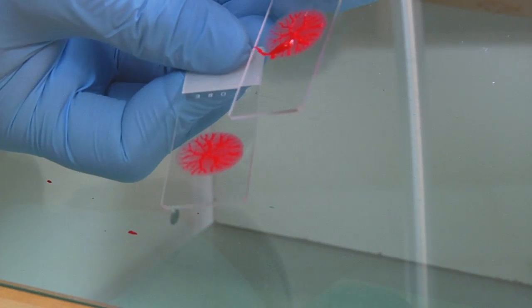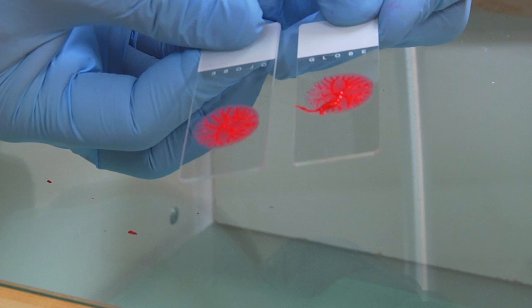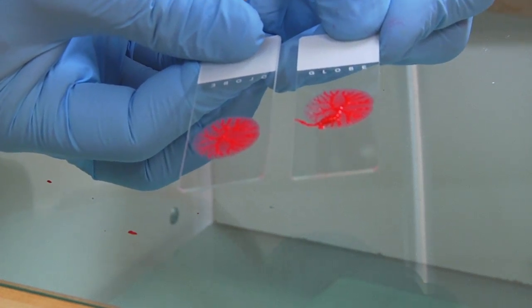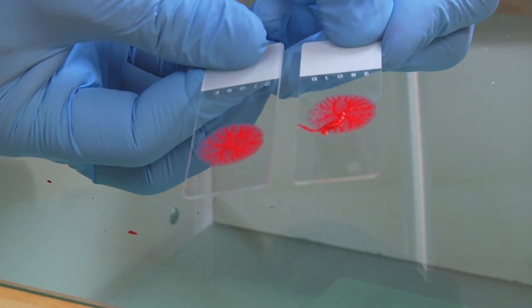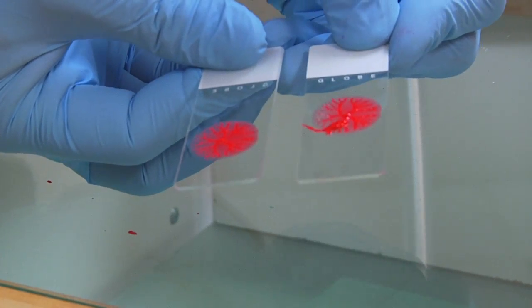As you can see there are ridges and valleys created by the material on the two slides which tends to dry the material that is in the valleys and leave the material that is in the ridges as unfixed.